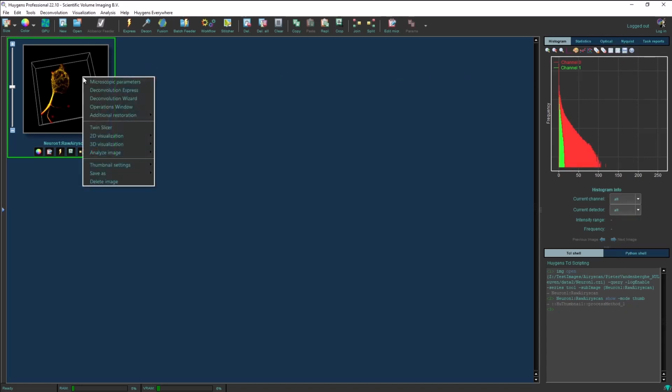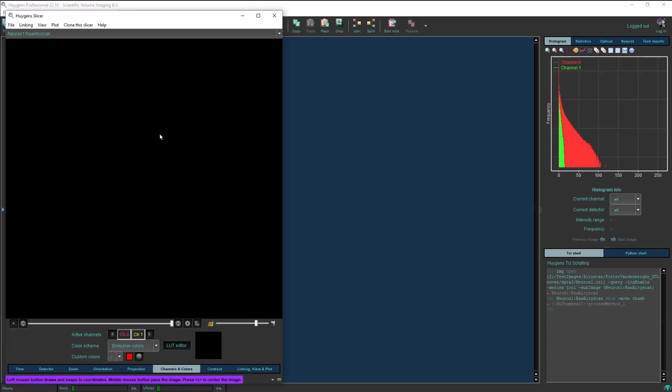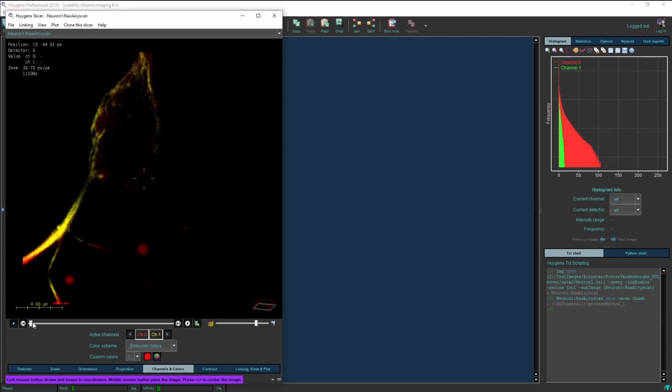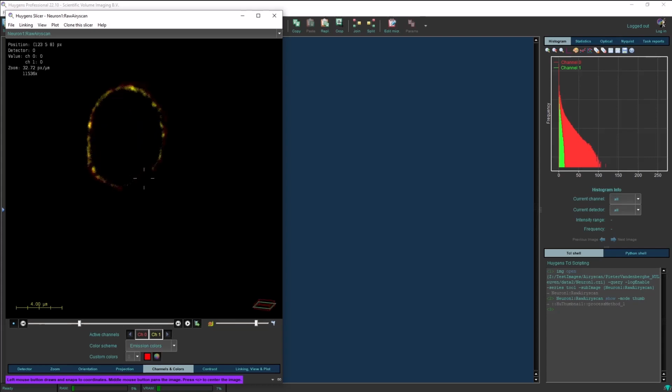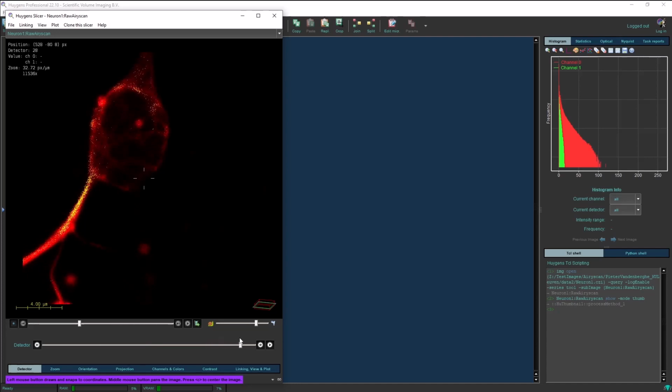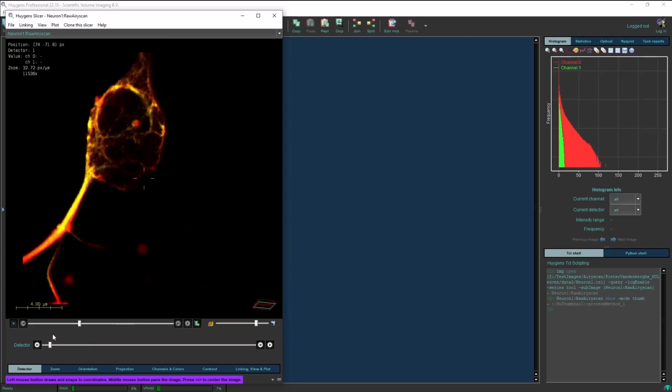Another way is to open a 2D slicer, for instance, and visually inspect the data. Let's now check this image slice by slice. And this is the data from the central detector, which is shown on the top left here. So we can also create a sum projection, which shows you all of the slices on top of each other, summed. And if we now go to the detector tab on the bottom left, we can visualize the differences in intensities in each of the detectors. You can really see the shift between each detector, each image acquired by each detector.